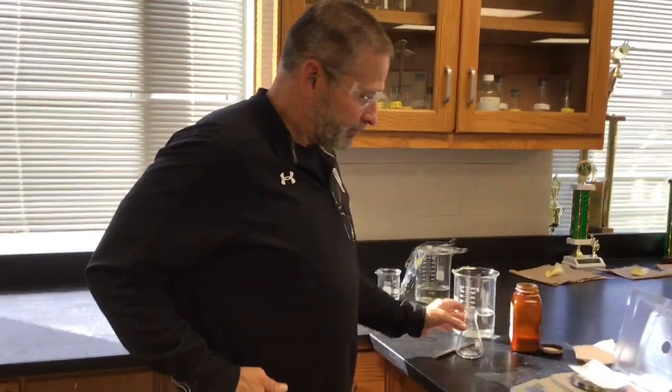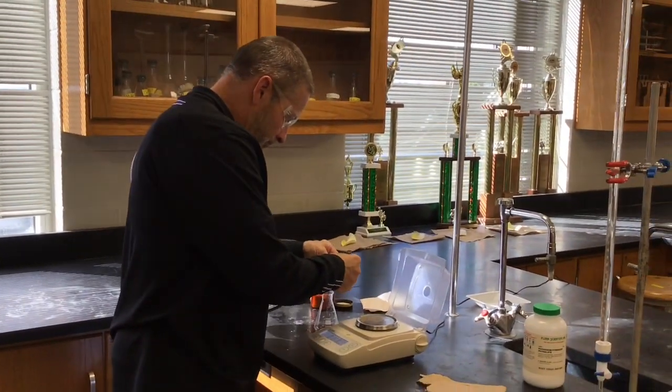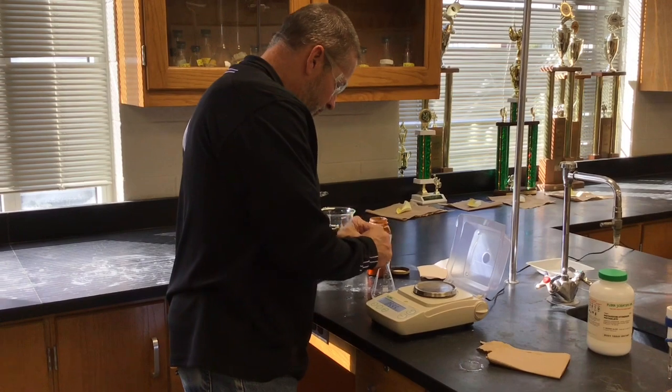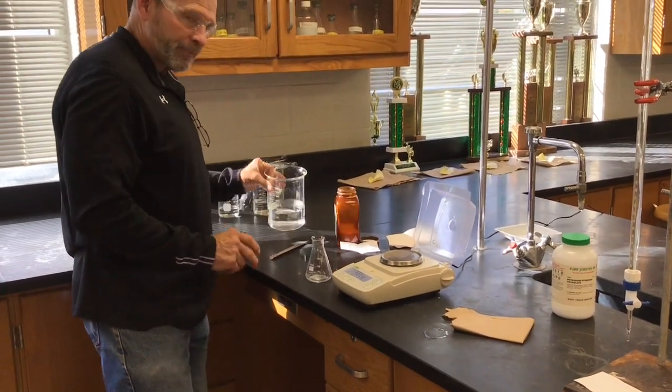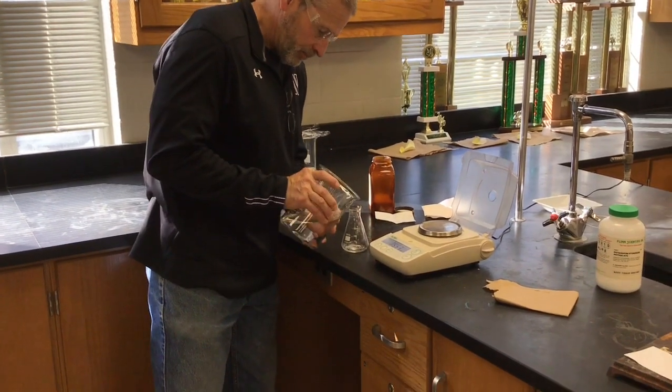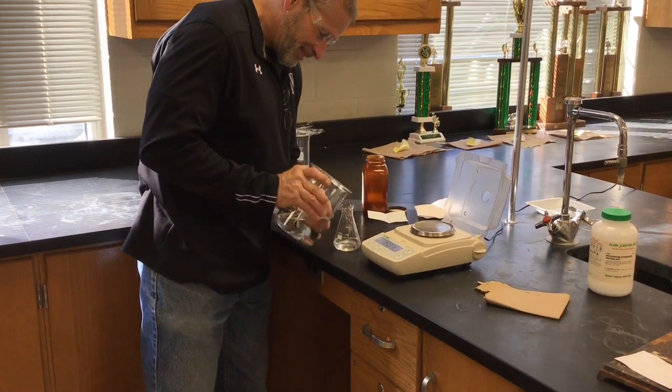Now, we've already done one trial. We did our fast and sloppy trial off camera just to save time, and you don't have to watch through that. It doesn't matter anyway because we wouldn't use that to calculate what the molar mass is. So we'll just do trials 2 and 3, assuming Mr. Helvel gets a good endpoint. Yes. And with this guy, that's a pretty good assumption.